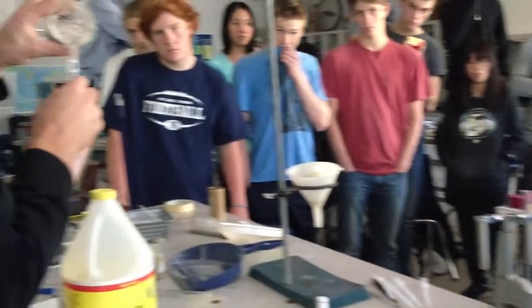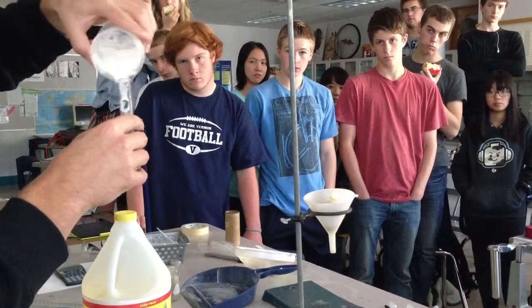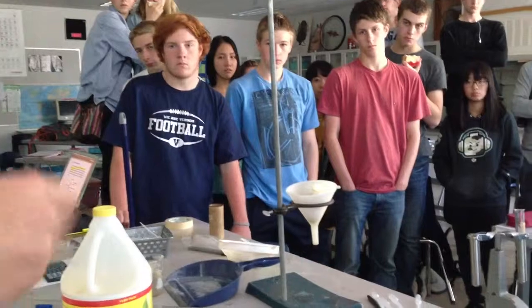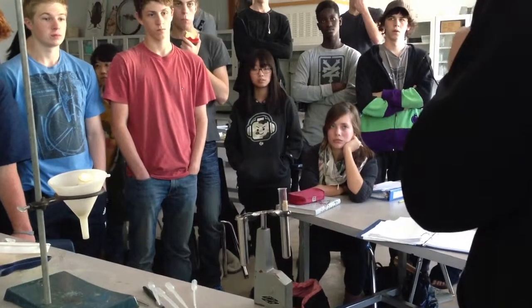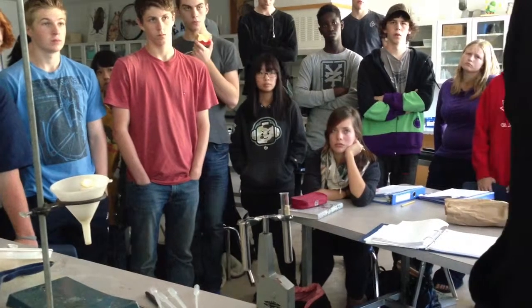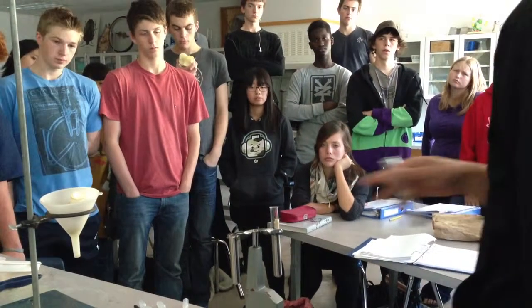This only works well with small amounts. And this was wet, so it's just going to make a big mess here. But anyways, they're mixed up now, and they're not separated based on density. What we can do is add a bit of water so that things can slide past each other. And then I could shake it and then just let it sit, but that's going to take like days or weeks for things to settle out properly because gravity isn't that strong.